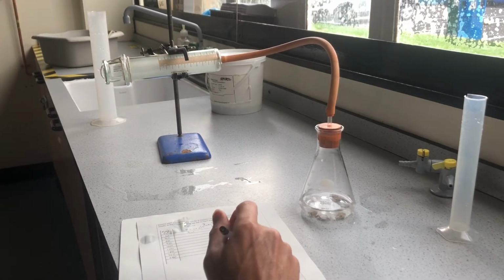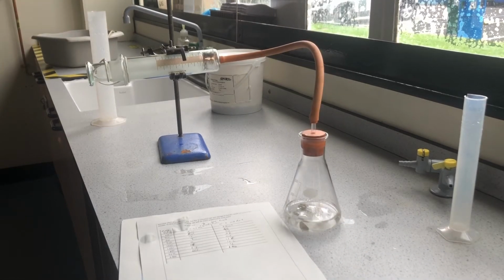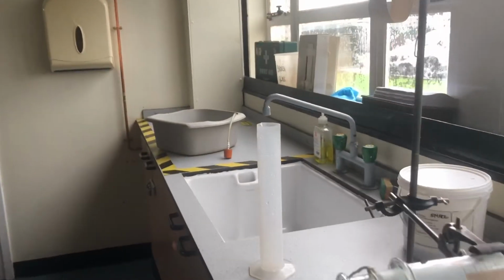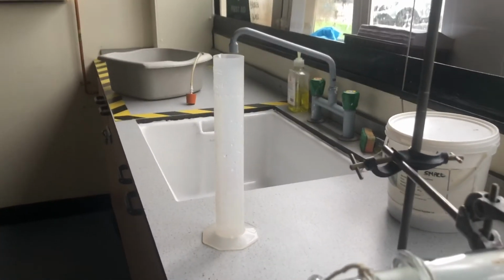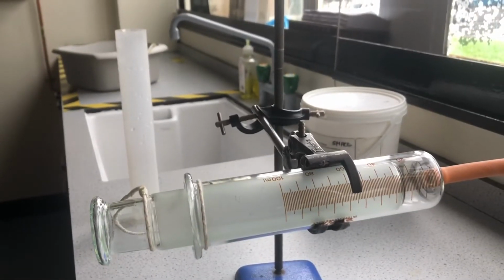And we'll collect the next reading in just a moment. So the experiment's been running almost 4 minutes now, about 10 seconds left. Let's see if we can take one final reading at 4 minutes on the gas syringe. Move that a bit closer, and that looks to me to be reading about 22 centimetre cubed. So that'll be where we finish, 22.